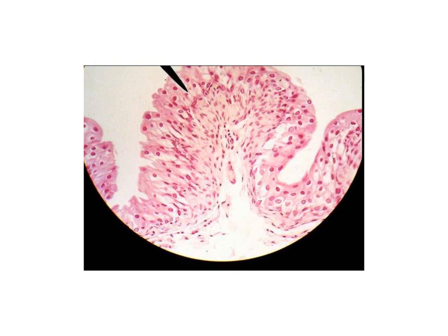Look at this picture also. This epithelium is stratified because it is formed of many layers of cells, as we have many layers of nuclei, more than 2 layers. And here we have the nuclei, especially at the top. Look at the top. They are rounded and it is a stratified epithelium, so it is the transitional epithelium. It's very evident that they are rounded in shape.